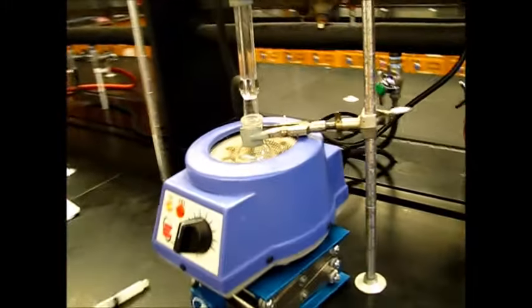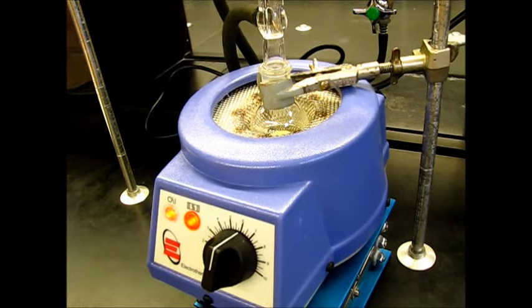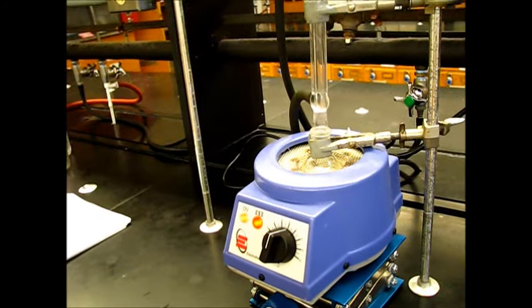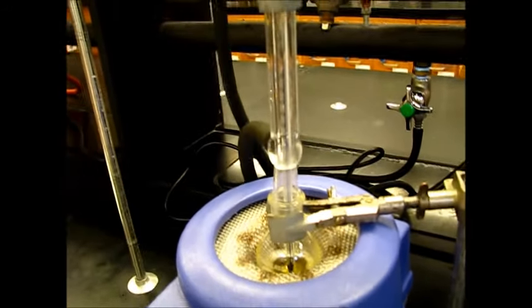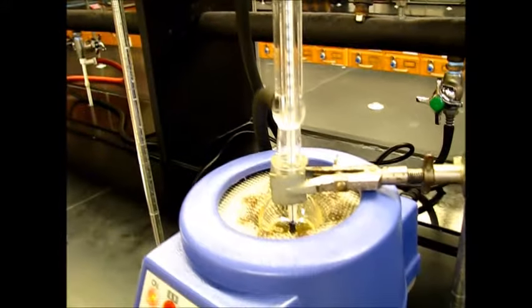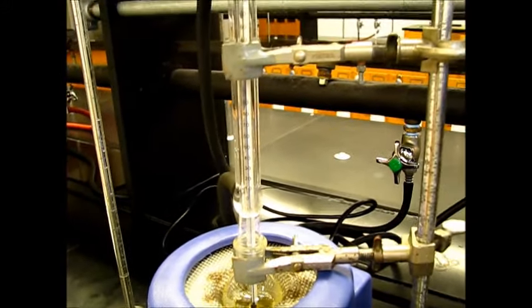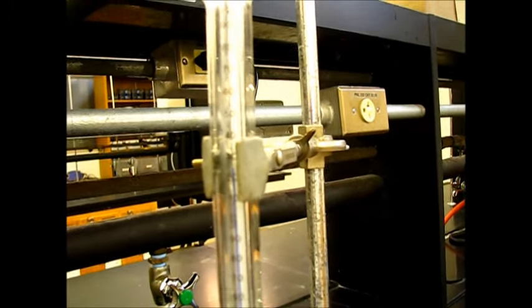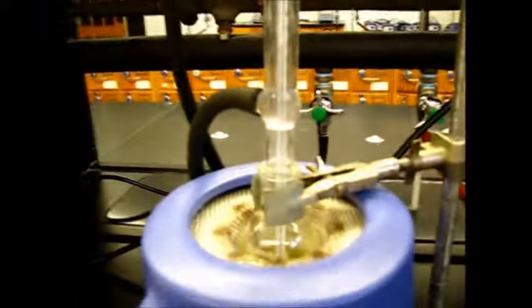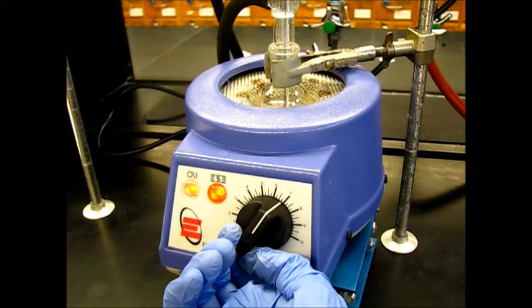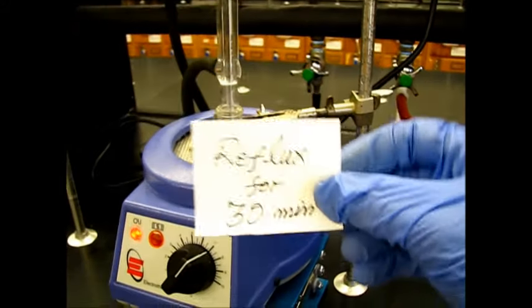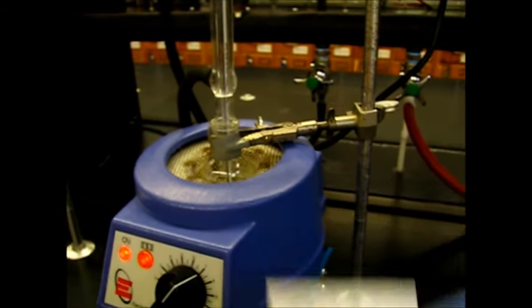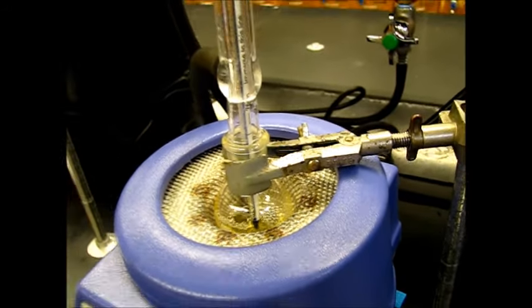Okay. Reaction has been set up. So we'll wait till it starts boiling and refluxing. So now you can see it start refluxing and let's check the temperature. How much temperature is right now. We can move little bit. Okay. We can see from this side. So it's around 125 degrees Celsius right now. And maybe we can crank little bit high in the heat rather than six to seven. And then it will keep refluxing. So we'll wait. We'll reflux for 30 minutes and then we'll come back for workup of this reaction.